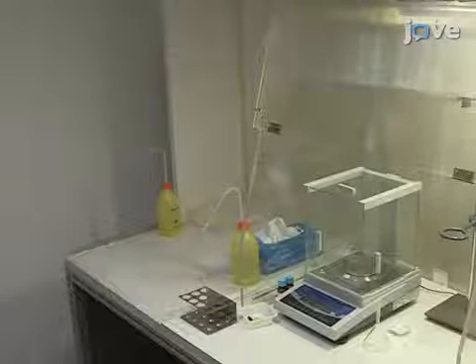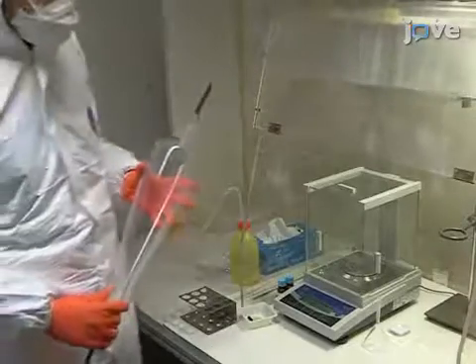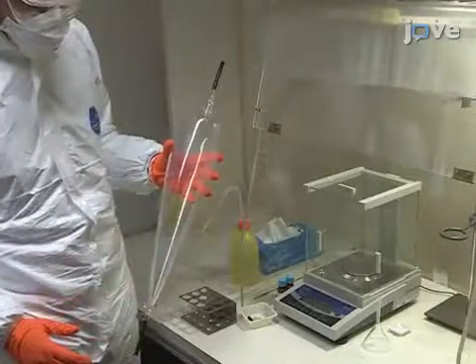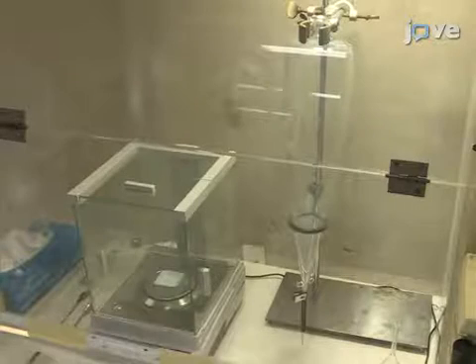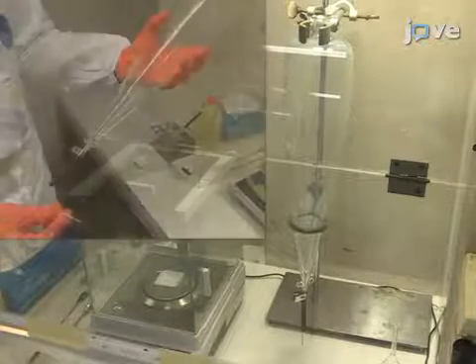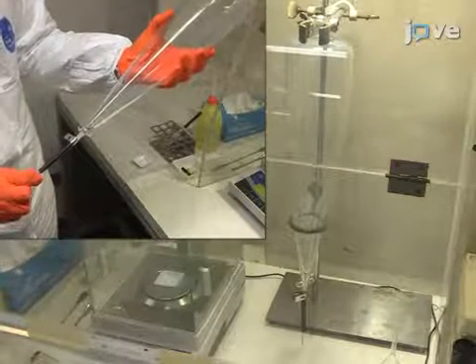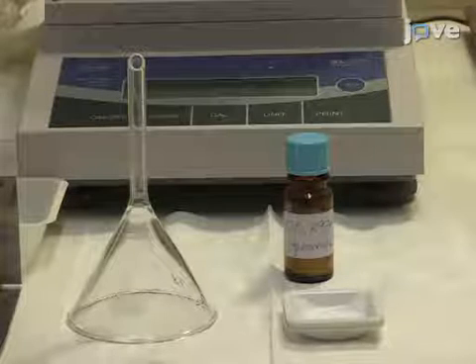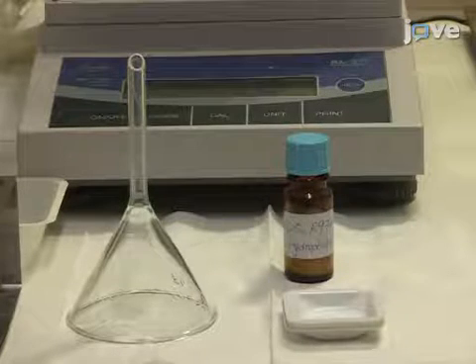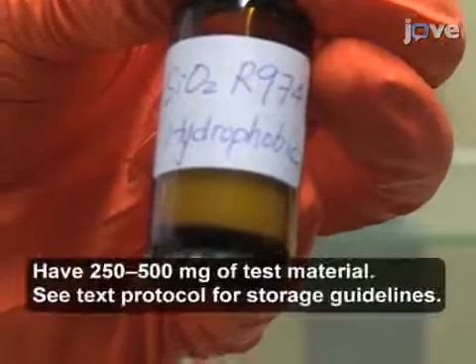To prepare the aerosol generator, it should be in a well-ventilated space, like a fume hood, along with a high-precision balance. Have the aerosol generator fixed vertically with its bottom opening blocked. Near the balance, there should be the test material, a glass funnel, spoons, and containers. This vial contains silica powder, which is the test material for this experiment.